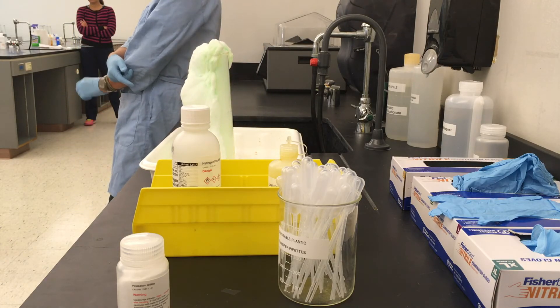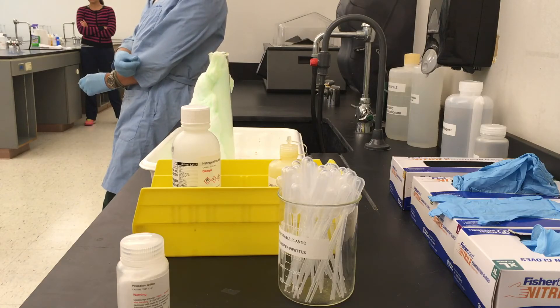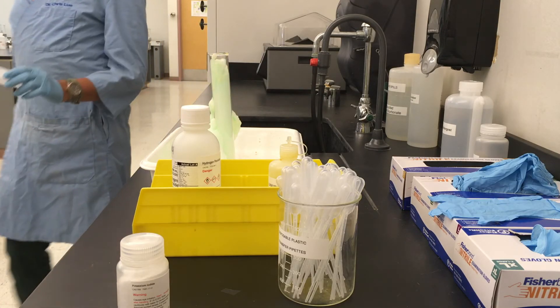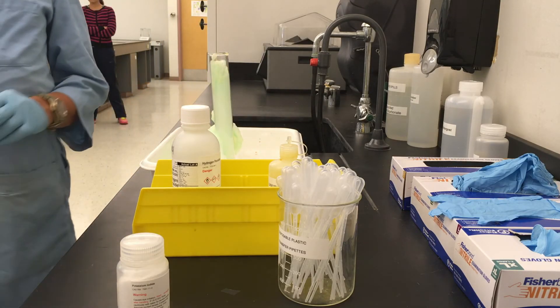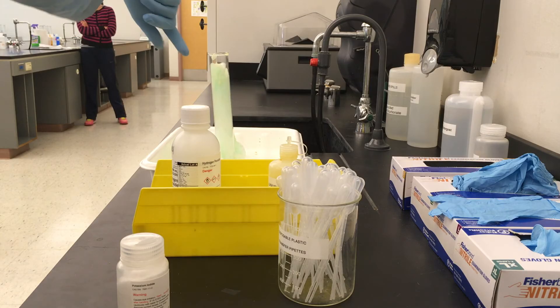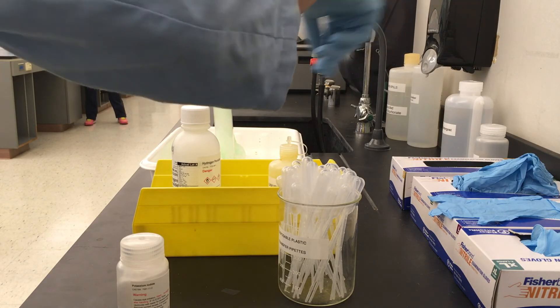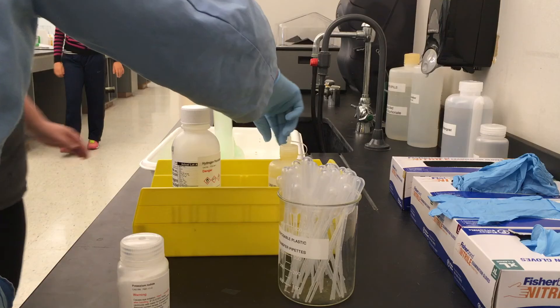Now I am going to measure out some potassium iodide, which I am going to put into a weigh boat. Then I will add the potassium iodide to the graduated cylinder.